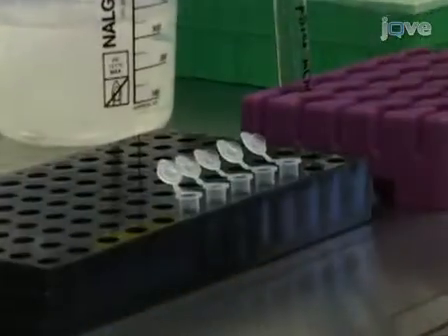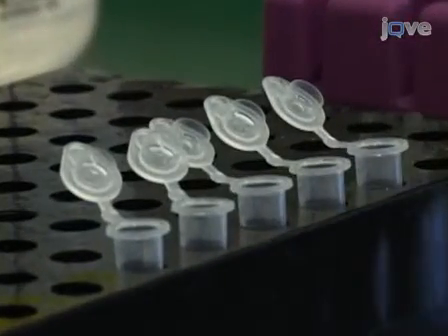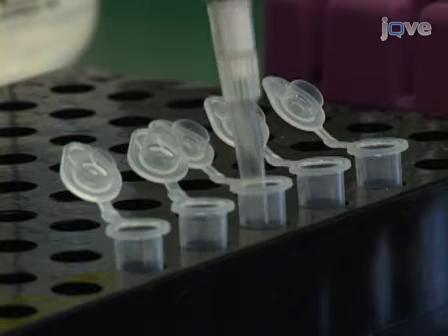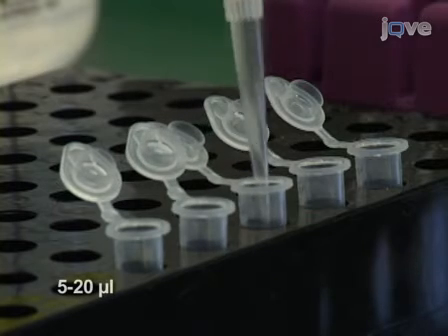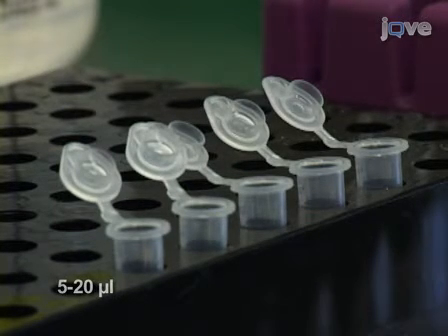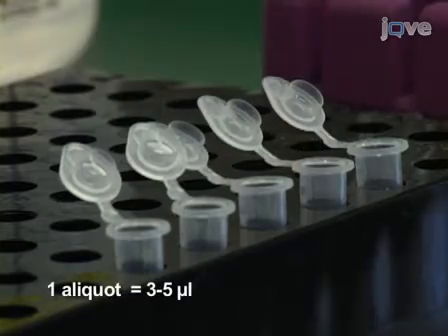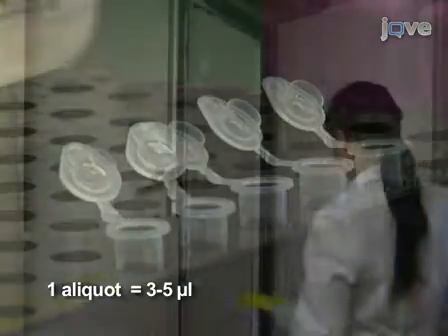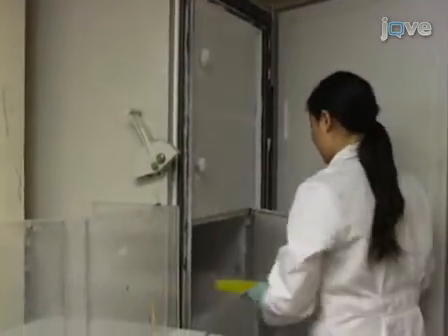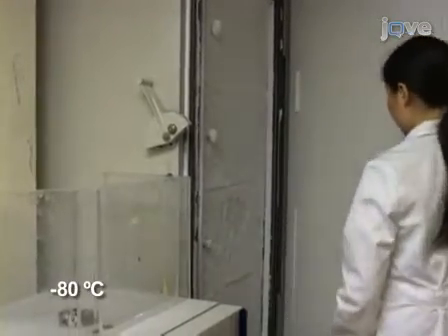Remember to treat all empty tubes with 10% bleach before discarding. If you intend to use the viral prep for longer than one week, make minimal aliquots of 5 to 20 microliters for future experiments and one aliquot of 3 to 5 microliters for the titration. Freeze and store the aliquots at approximately minus 80 degrees.